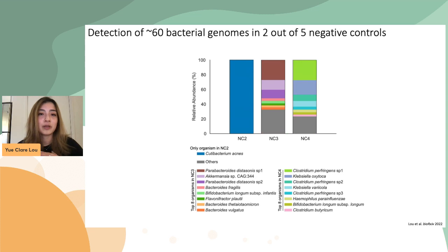Here I'm showing you a closer look. I'm plotting the top 8 most abundant organisms. Just by looking at the species name, it seems like the majority of the genomes detected in NC3 and NC4 look like common gut microbes. So to look for the sources of contamination detected in negative controls, we decided to look for near identical strains that were shared between fecal samples extracted from this project and all the negative controls.